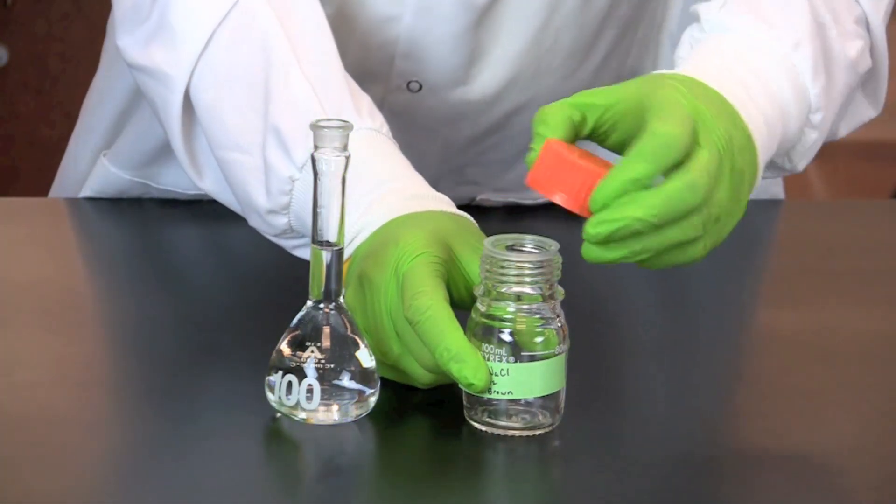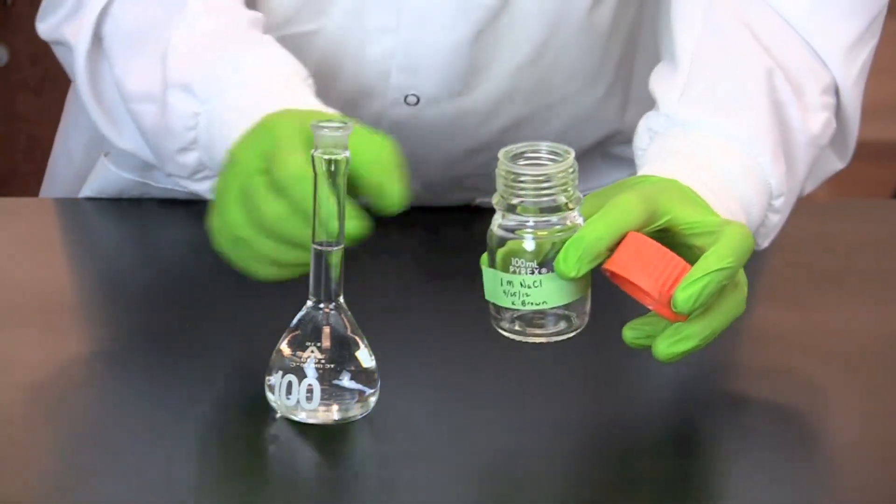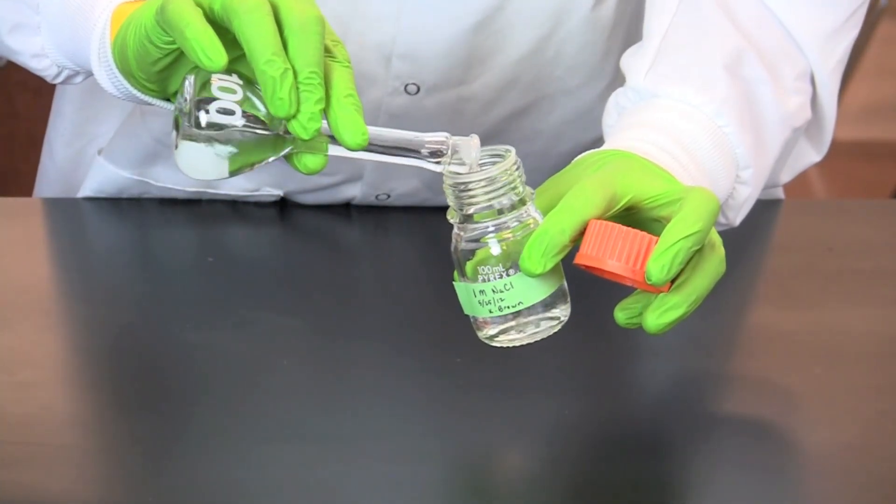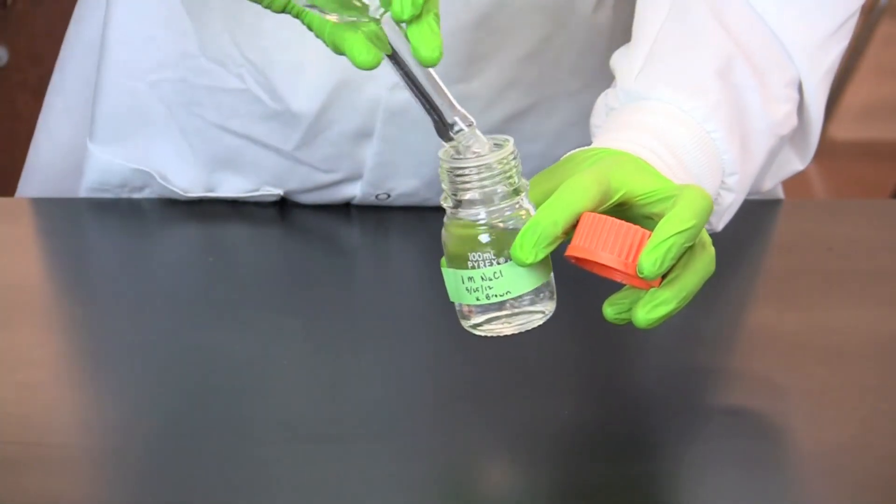Carefully transfer the solution to the reagent bottle. Notice that the reagent bottle lid is held while pouring. This prevents the lid from touching surfaces and prevents contamination.